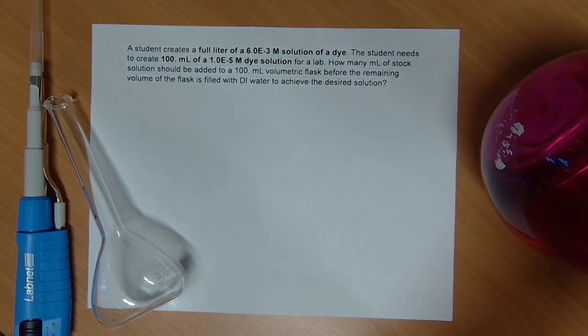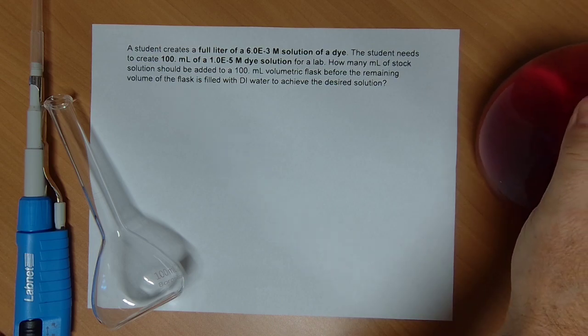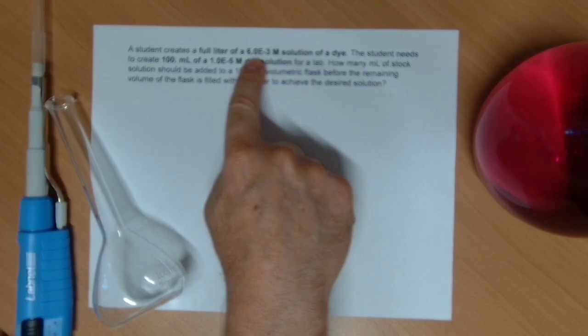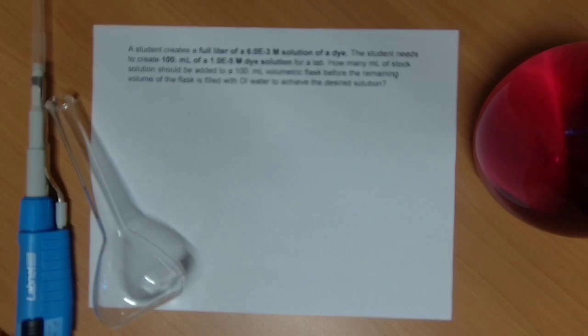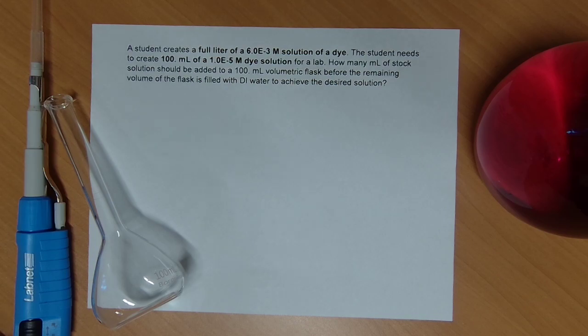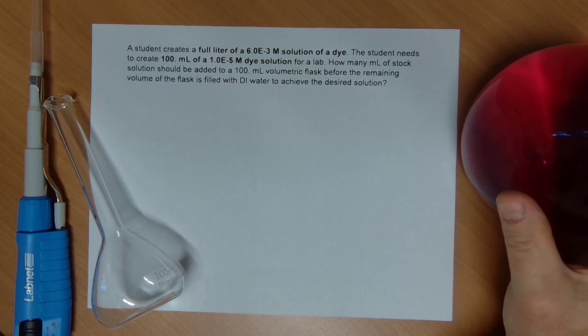This is crystal violet, and there's a liter of it sitting over here. I didn't bother to try to accurately make up my solution, but this is probably not an unreasonable number to have the concentration of that dye be 6 times 10 to the minus 3 molar, or 6 millimolar. Sometimes these big organic dyes are super potent, and it doesn't take very much for them to really drastically change the color of a solution. All right, so here's my start material. So this big guy right here.